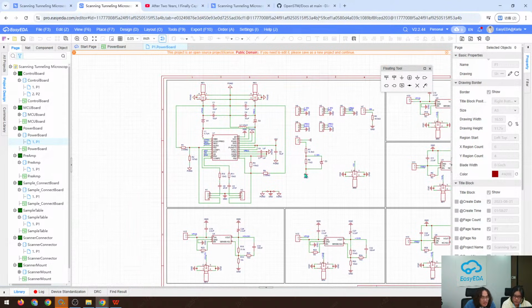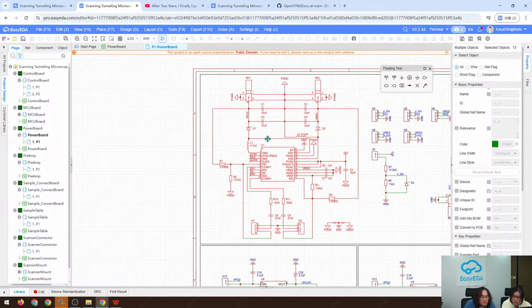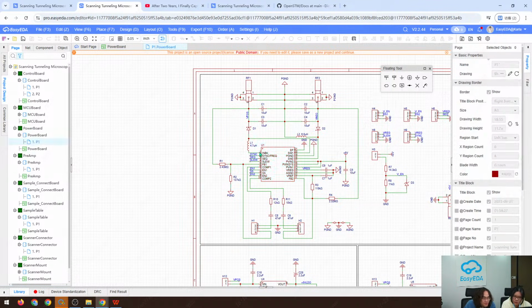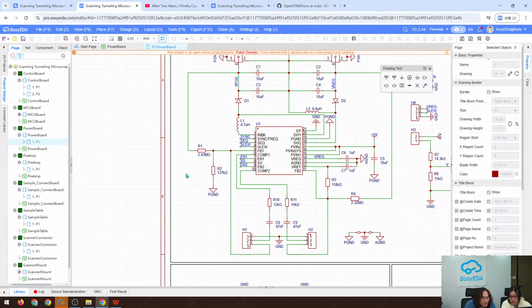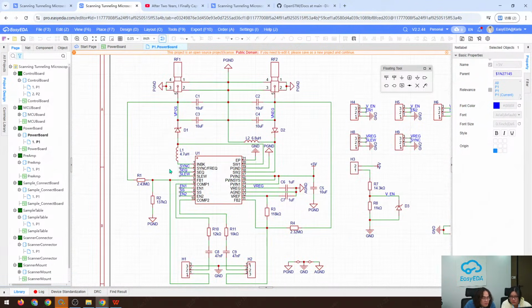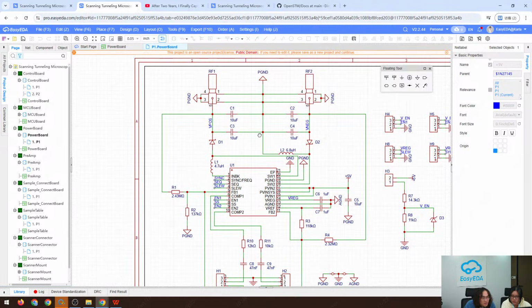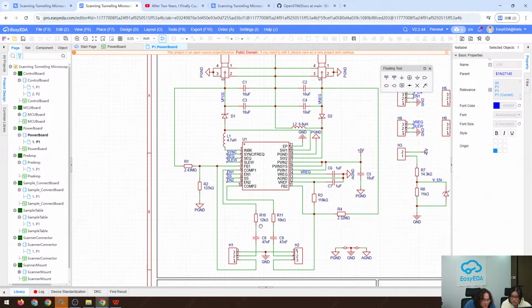So the power board is basically a booster circuit, with the ADP5070. The input here is 5 volts, and the output, I drew it a long time ago, so I need to spend some time to find the label.